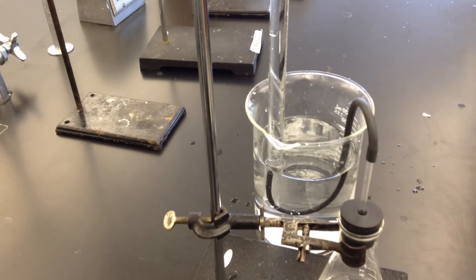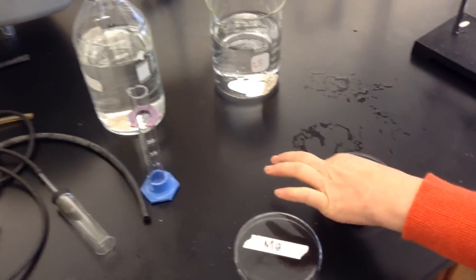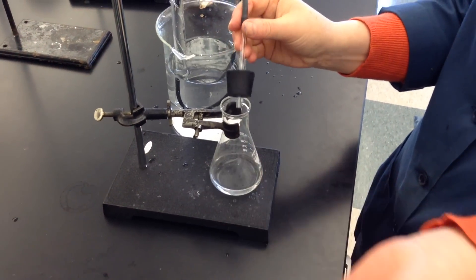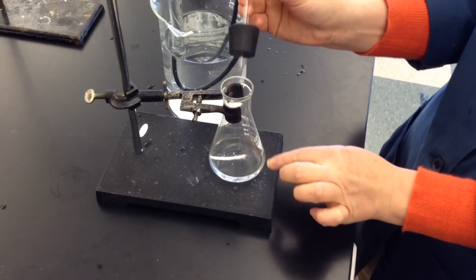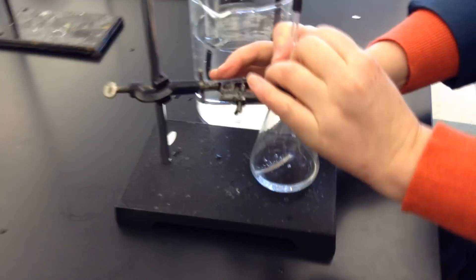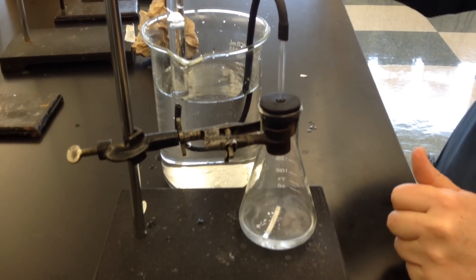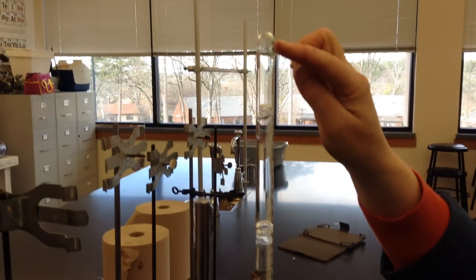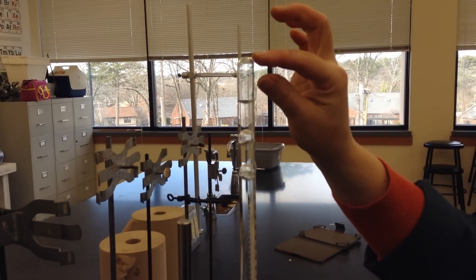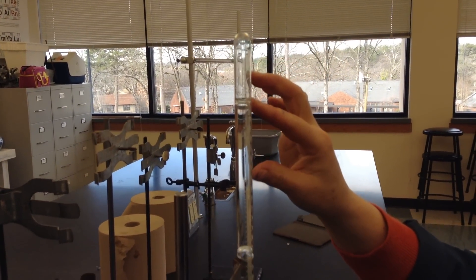So then however you decide to time this, I can put my metal in here and it starts to bubble. I put the cap on. That gas is now being collected here and I can time how fast the gas is being produced.